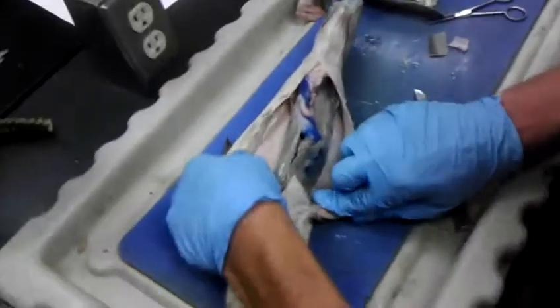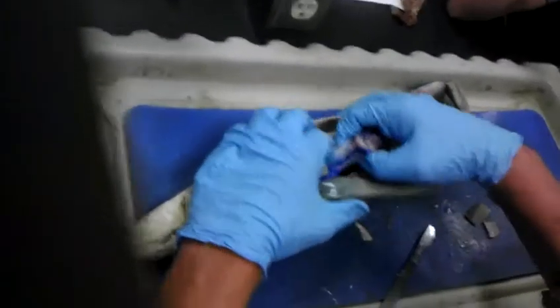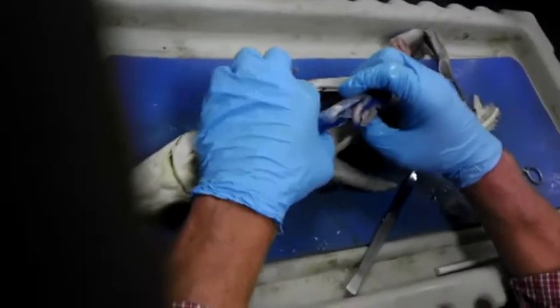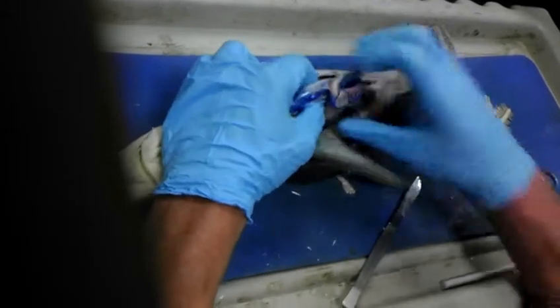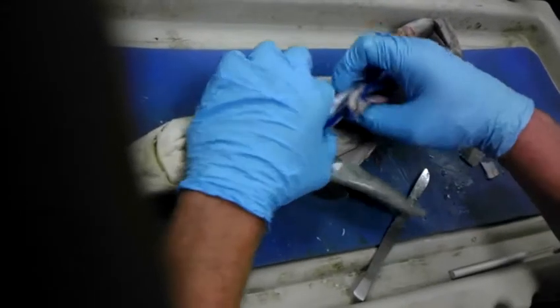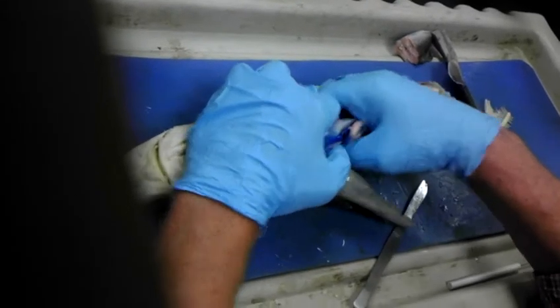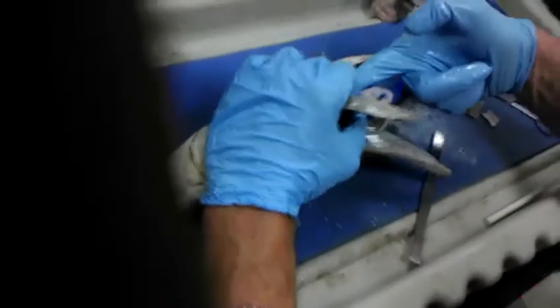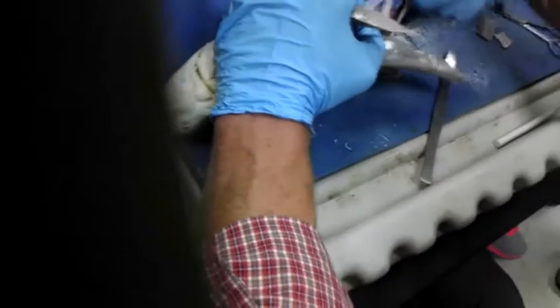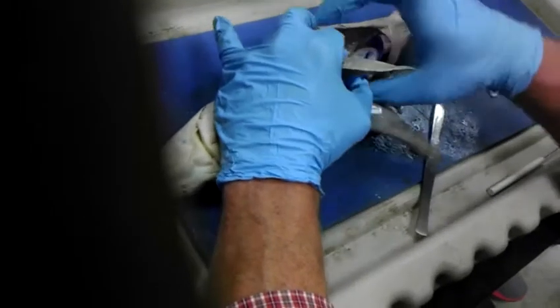All right. So a lot of stuff in here. Notice that you got this connective tissue. We'll collectively call this peritoneum, right? Peritoneum on the side, connective tissue all in here to keep it all, and this is all mesoderm derived, keep everything in place here. And also this denotes the, remember in embryology, we're talking about the coelomic pouches? This is one side, this is the other side, and they all grow together.